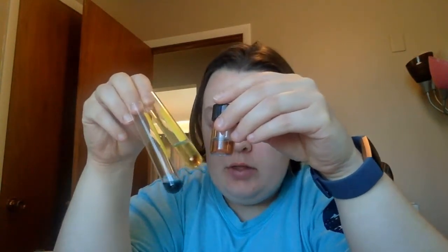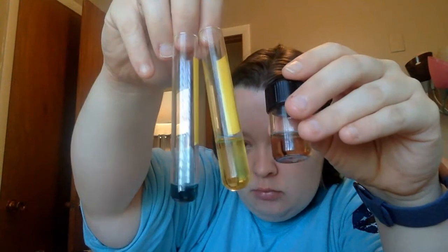Our goal is to look for the red rafinotoxin, and of the 3 that we have, the one that looks closest to something that could contain a red toxin is the brown, and that's why we collected it separately. So what we're going to do today is a second type of chromatography, in an effort to separate this out and see if there is any red rafinotoxin present in that sample. These other ones I'm going to go ahead and discard because I know that there's no red rafinotoxin present in them.